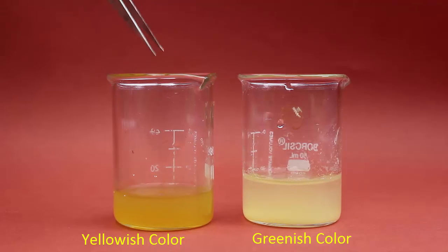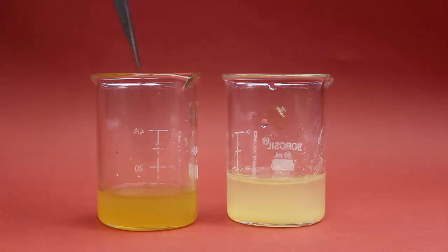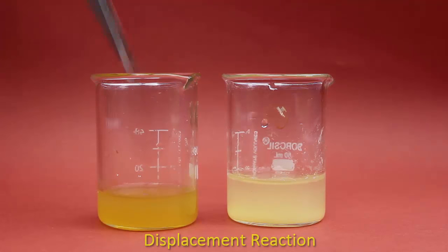This is a piece of zinc here. Zinc sulphate solution is prepared and iron will be deposited at the bottom of the beaker. So this is an example of displacement reaction.